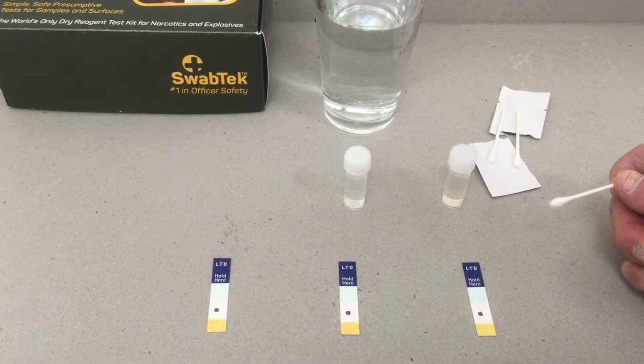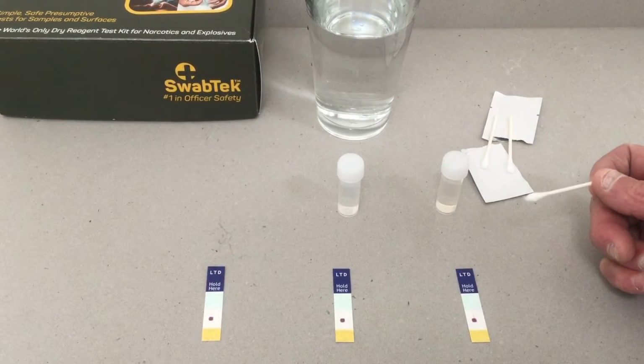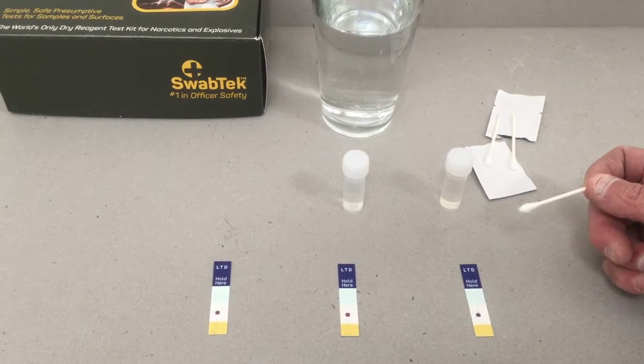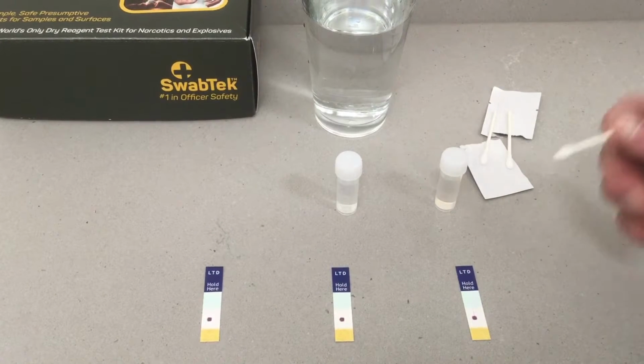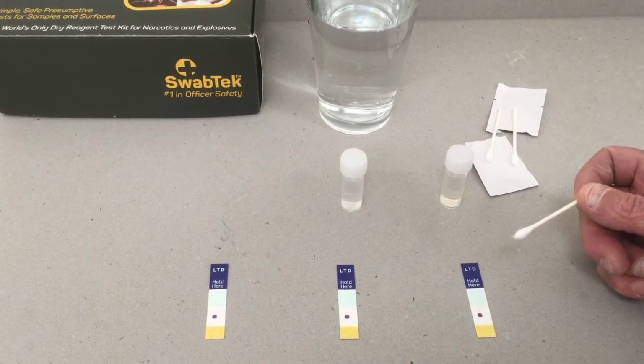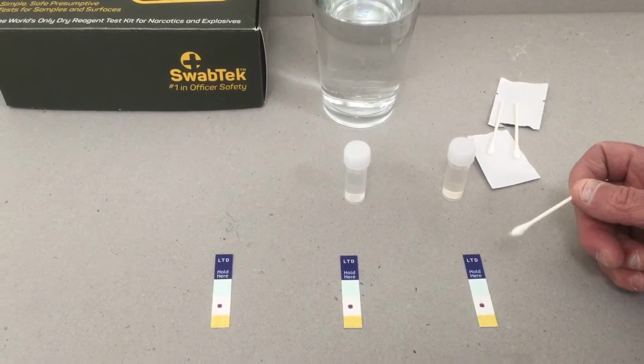We're going to be looking at liquid threats, so precursors to explosive liquid components. Again, as with any of our tests, if you're really not sure as to what are positive indications, do a blind test, do an absolute negative.